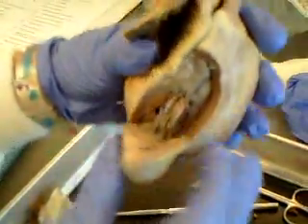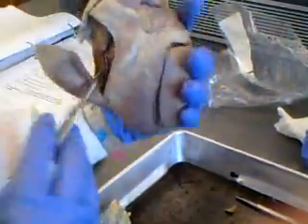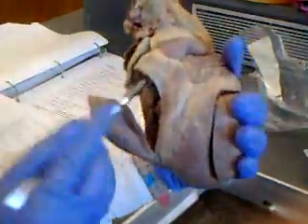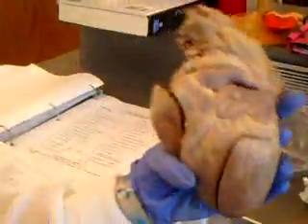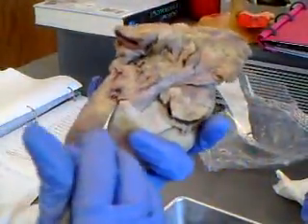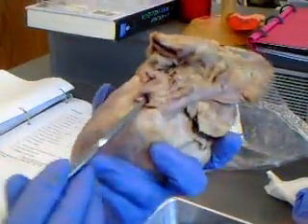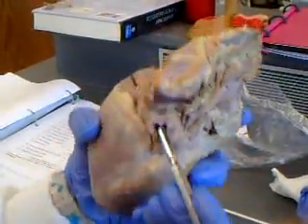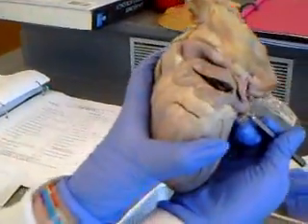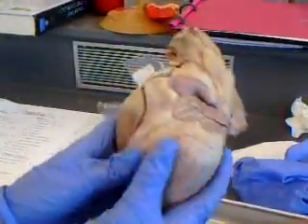And then through there, it's going to flow through the pulmonary valve into the pulmonary artery, which is going to flow to the lungs and back. Which one did we decide was a pulmonary vein? That one. Yep, because here's where the pulmonary artery exits into the lungs, flows back to the pulmonary vein, collects into the left atrium, where we'll start over again.